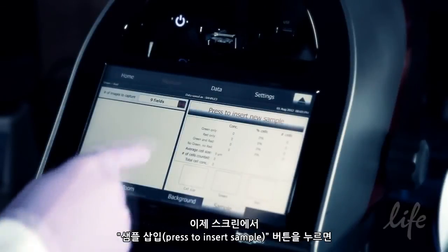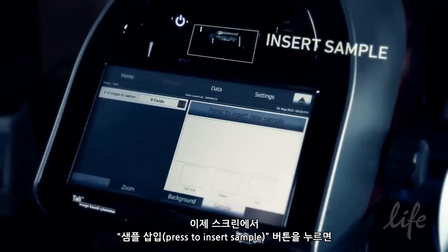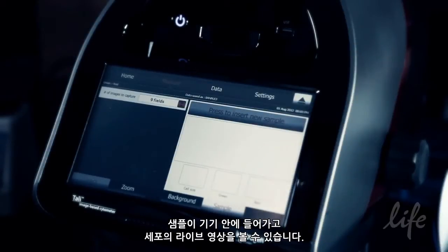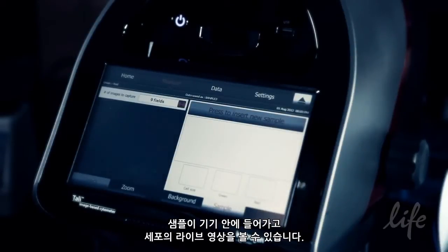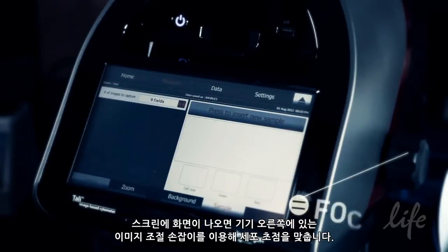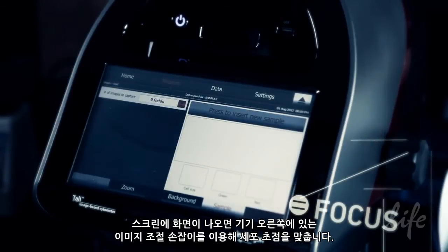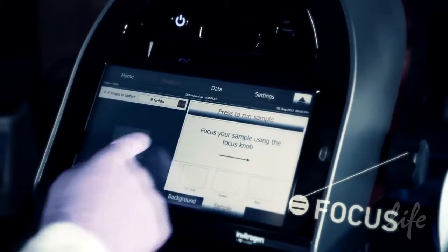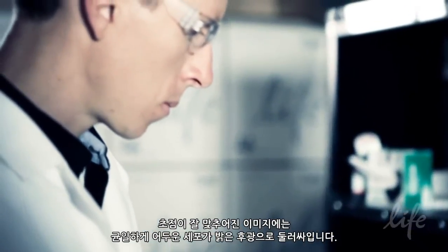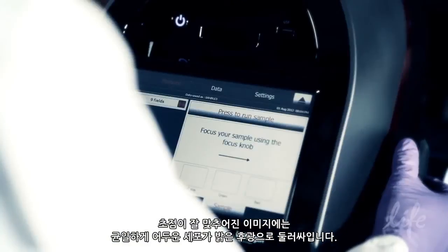Now touch the 'Press to Insert Sample' button on the screen. Your sample will be drawn into the instrument and you'll be shown a live view of your cells. When prompted, focus the cells using the image adjustment knob on the right side of the instrument. Correctly focused images have uniformly dark colored cells surrounded by bright halos.